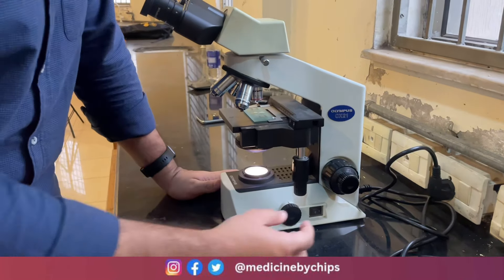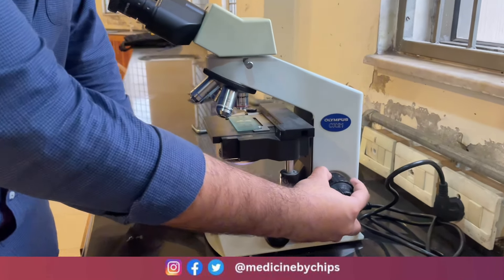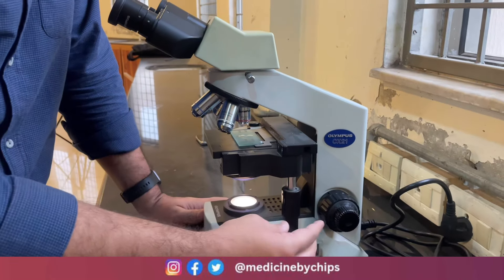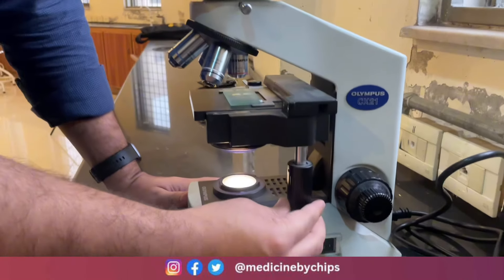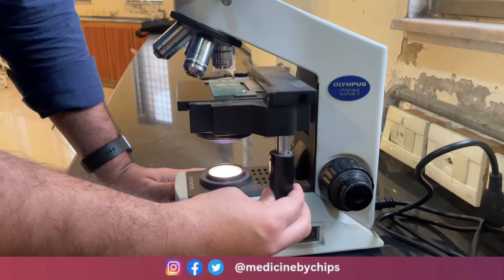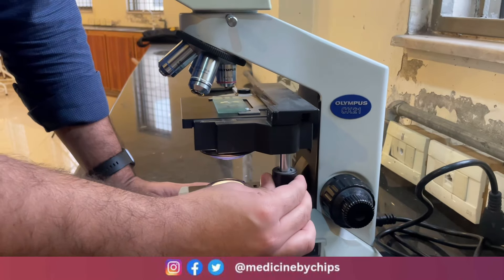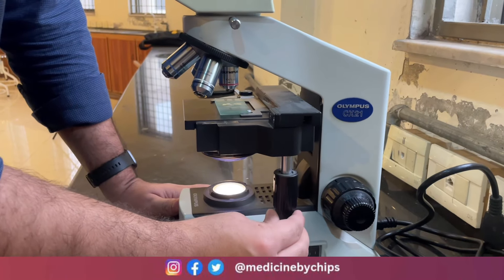Next we have the coarse focus and the fine focus, and the stage movements which can be done with the bottom one and the top one for up and down movement.